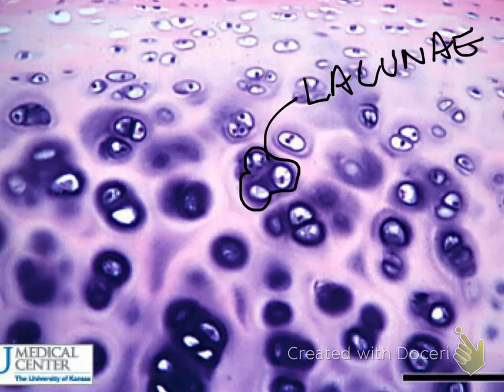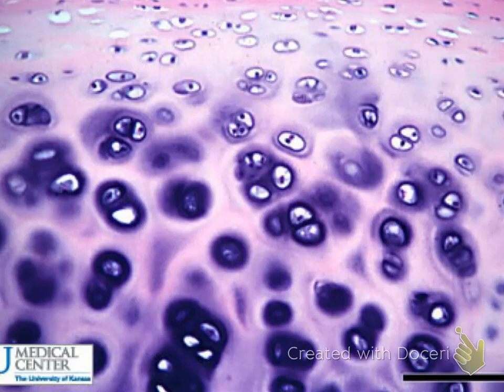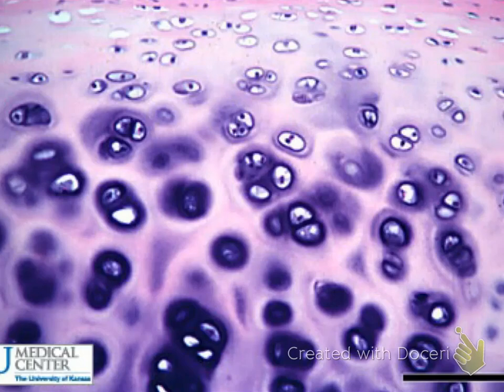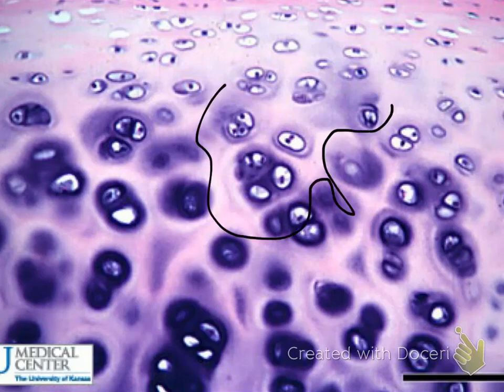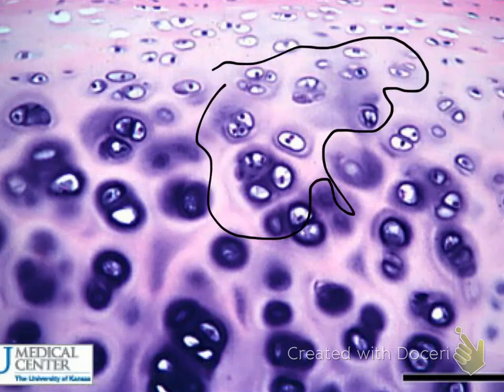Once you've decided that it is a cartilage cell, you need to look for fibers. If you don't see any fibers, like in this tissue, then you know you're looking at hyaline cartilage. All of the non-cellular portion in the background — all of this background stuff — this is your ground substance.